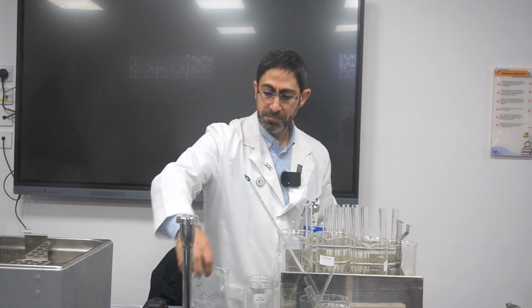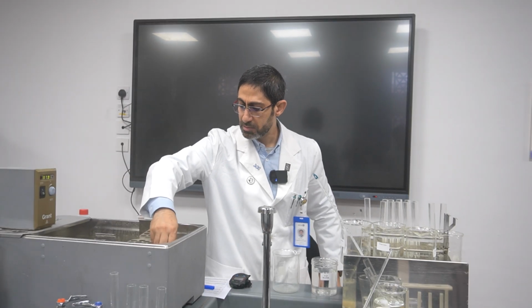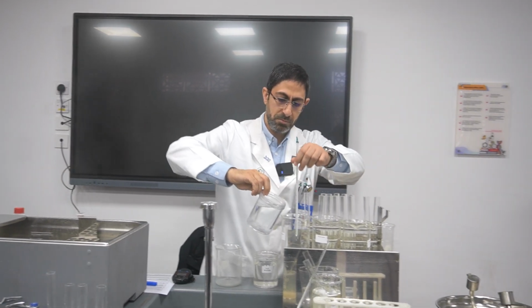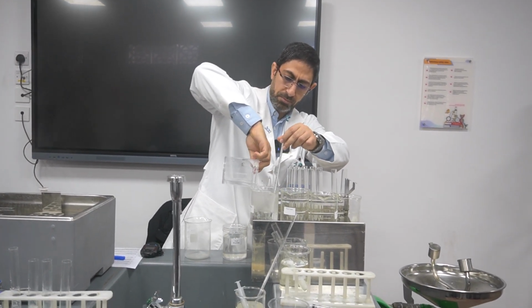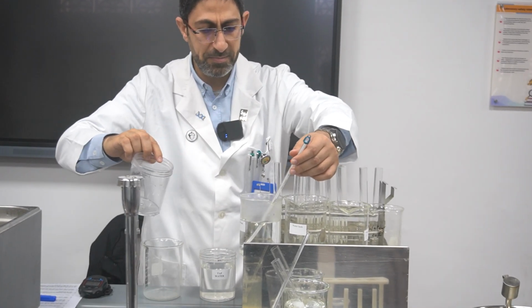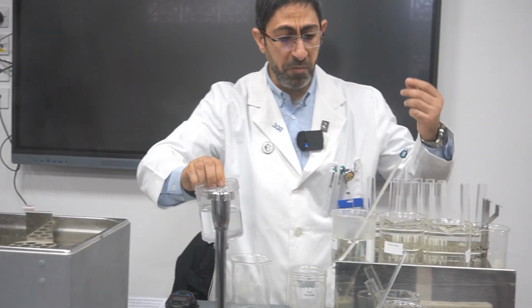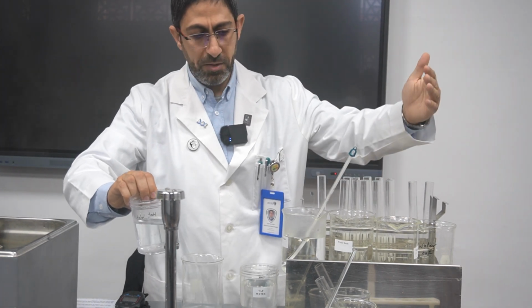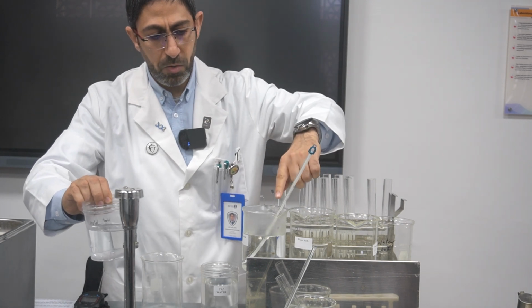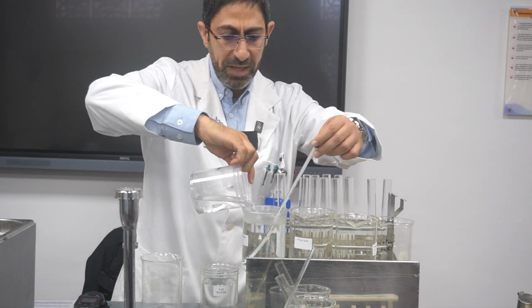But here I'm going to use hot water at 100 degrees Celsius. Yeah, it's boiling now. And to make it more conventional, because as you know, the denaturation will be closer to 50 or 60, I will use it at 80.